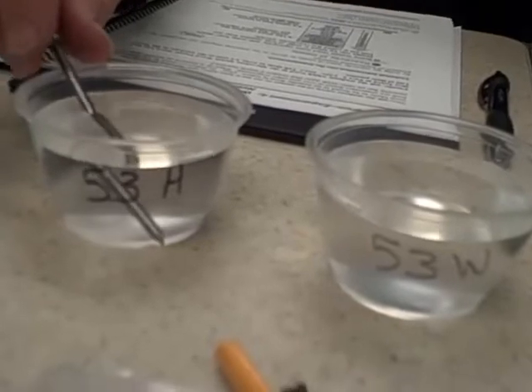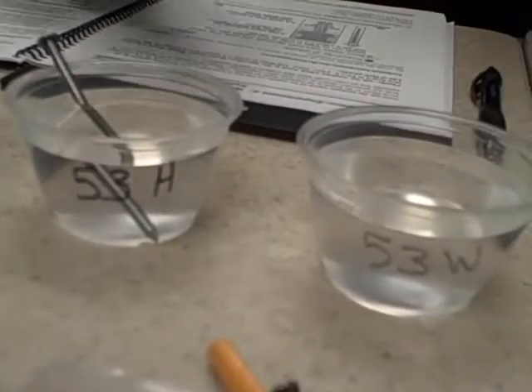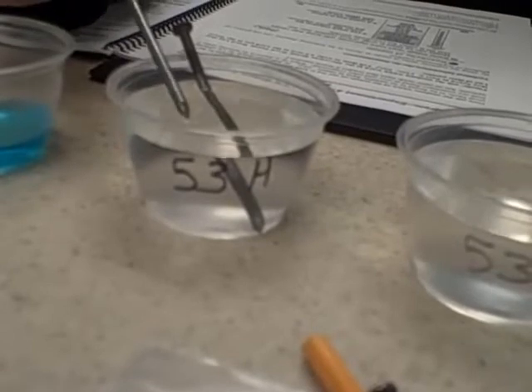Okay, where are you? Peroxide. Does it say H? It says H. Yeah. Go into the cup of water. All we're going to do is wet the nail so the salt will stick to it and not fall off when it goes into the peroxide. Okay. Roll them in the salt to get salt on the nails.